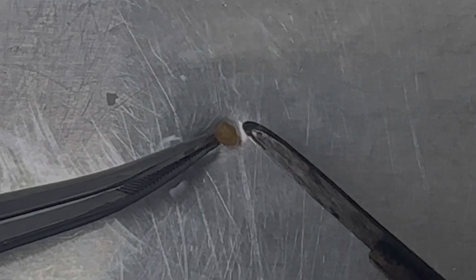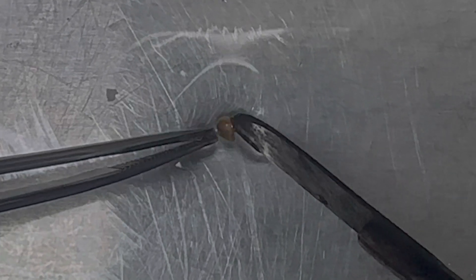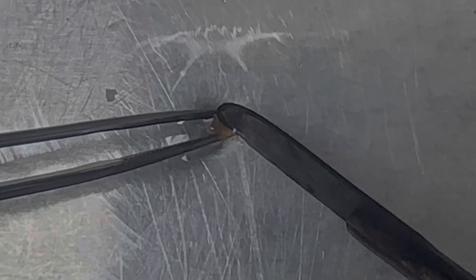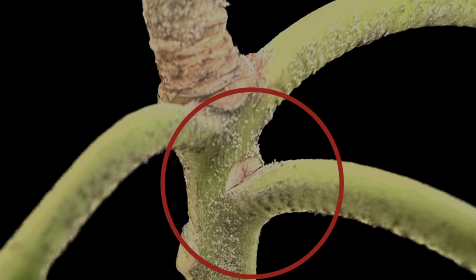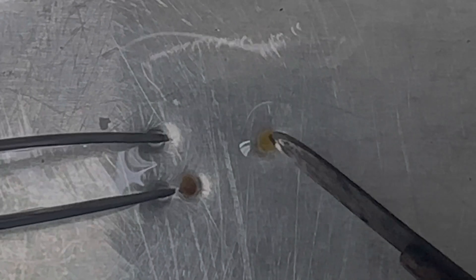So let me explain. This is a rhododendron, and what I did is I cut at the node — you can see the shoot tip that is coming up. So I took that off and this is what I'm using to try to introduce to tissue culture. This is the tip.